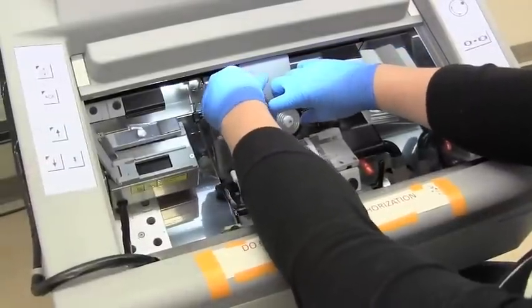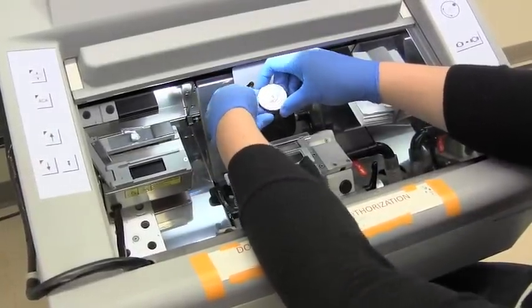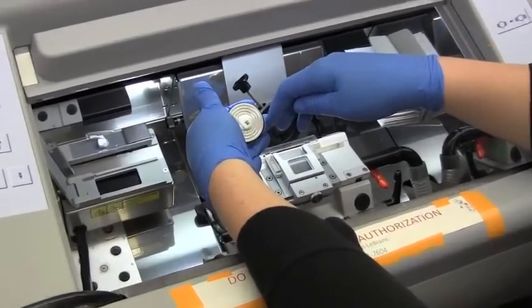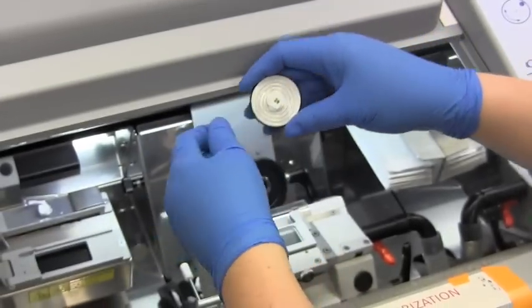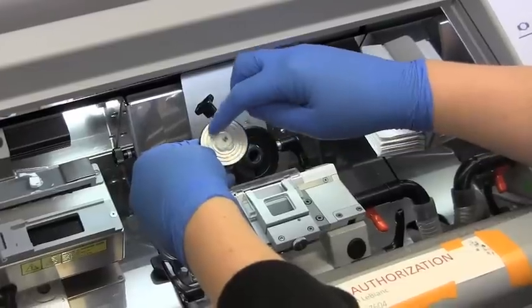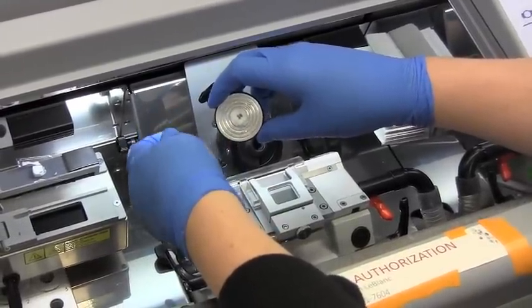To prepare for cleaning, reverse your steps to remove the chuck. This can sit in the sink to defrost, and you can wash the stems down the sink, or put it into a garbage so that the matrix comes off. Just be sure to clean it really well when you're done to get anything out of the rings, because that will prevent things from adhering very well in the future.